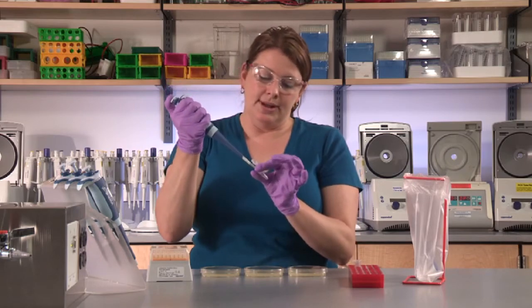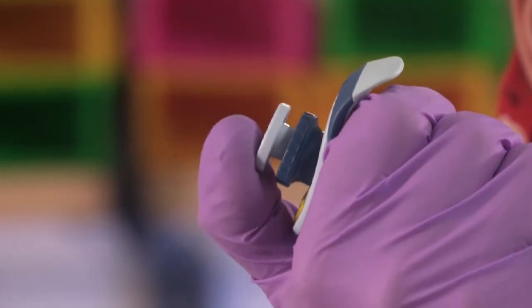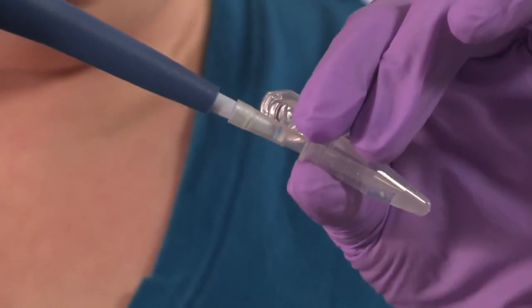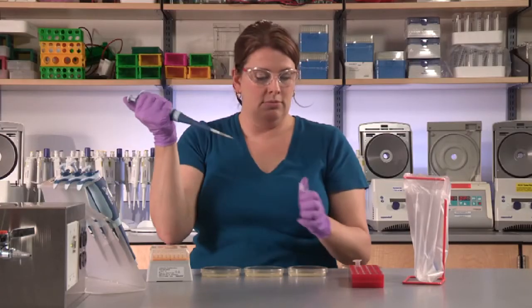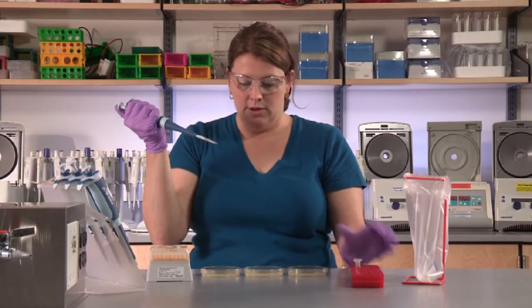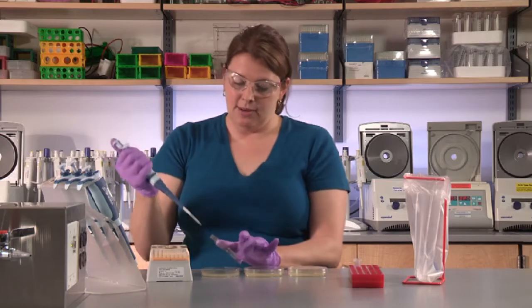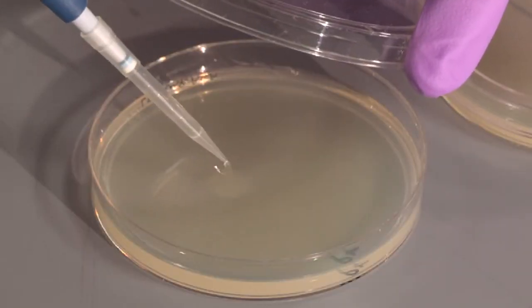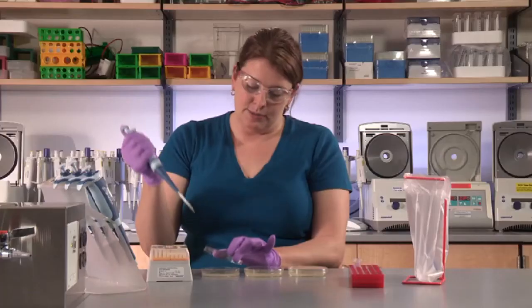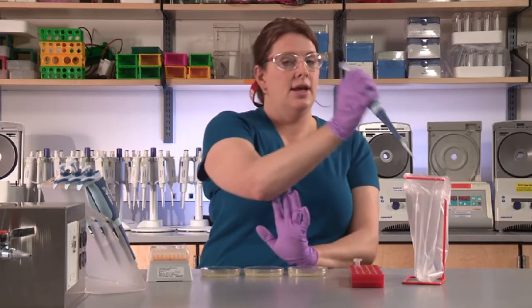Pick up the remaining P+ cells, being sure to gently mix them up and down so that they're dispersed for plating. Again, open the plate minimizing air exposure, disperse the cells, and eject the tip.